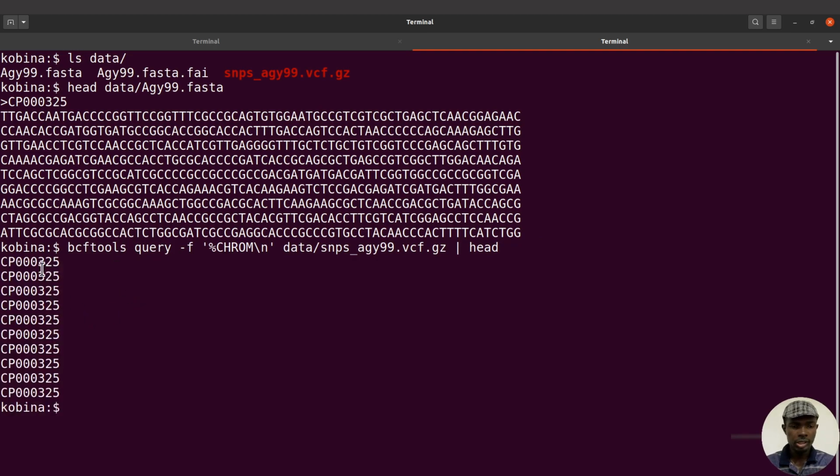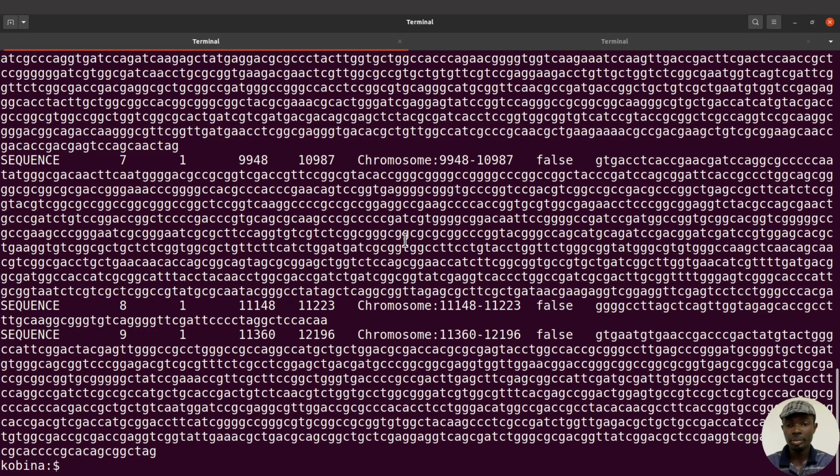So here we see the chromosome. So there's the accession ID. This one matches what is in the reference sequence. All right. But when we come to the SnpEff database, we don't see that. We rather see the name chromosome, which is here. The difference in the names is what caused that error, chromosome not found, to be displayed, because SnpEff is expecting to see this name in the VCF file.